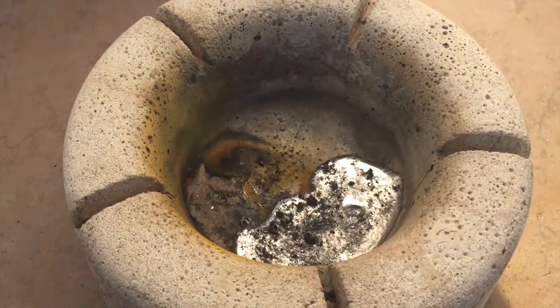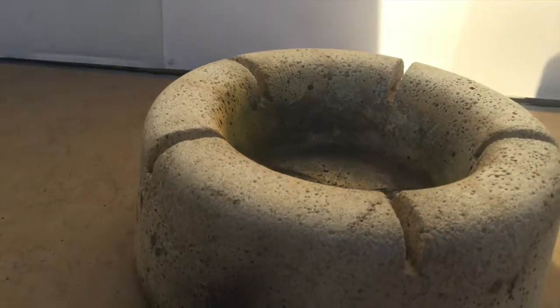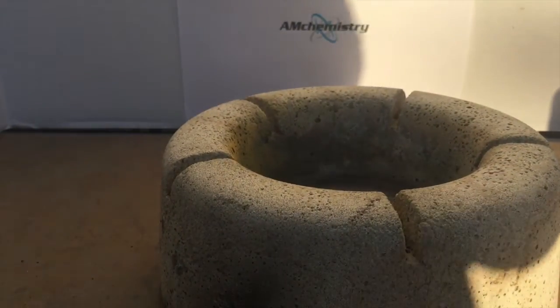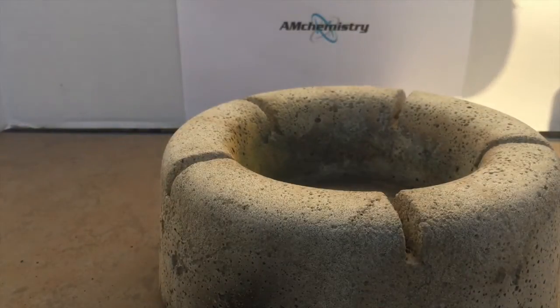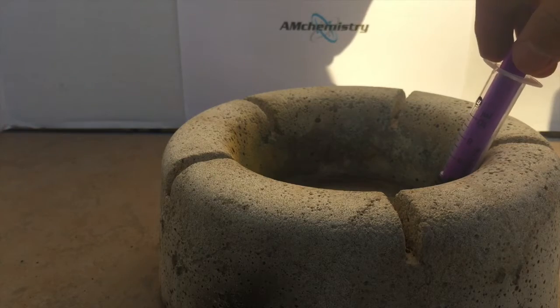Once it's all melted together, just pour it in cold water. In my case I'll be making Wood's metal alloy shots, so I'm just gonna make shots using a syringe and add them into cold water.